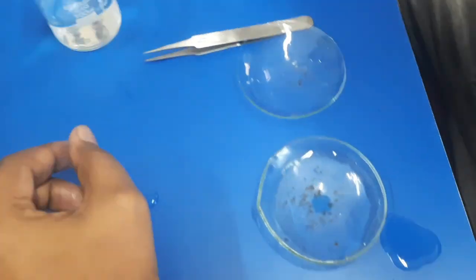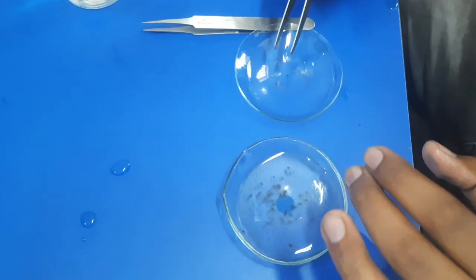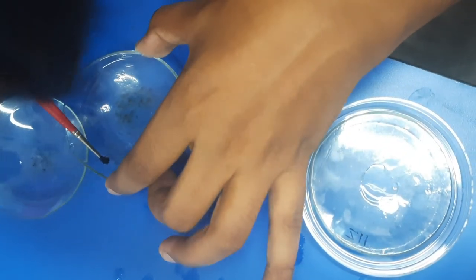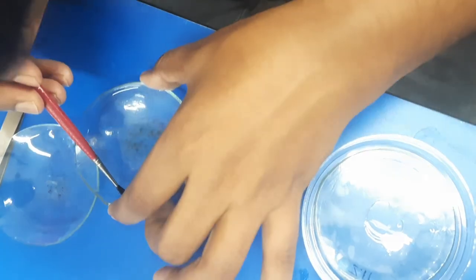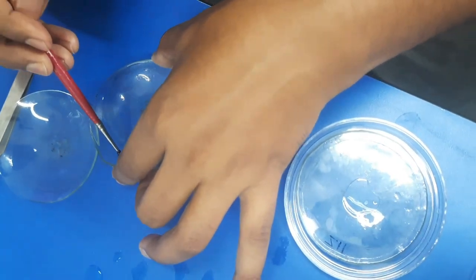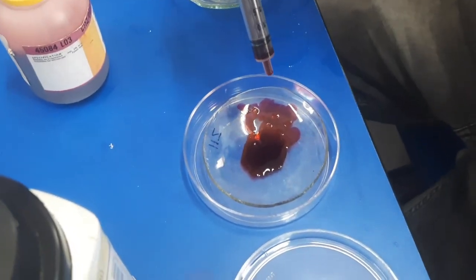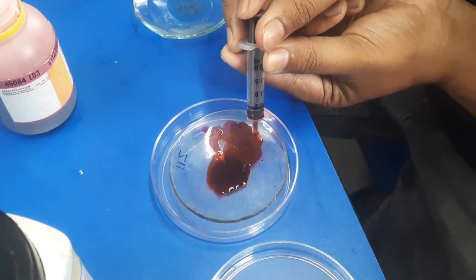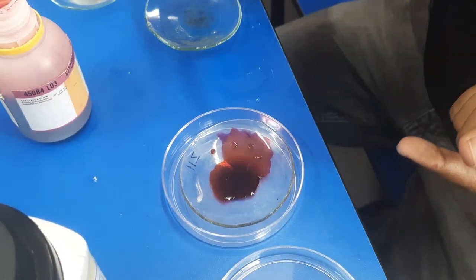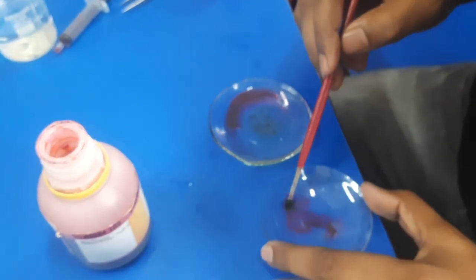We will use a brush or forceps and try to clean the scales a little, so that the blackish pigmentation is removed. After that, from these scales, those which are very well cleaned, we will separate those out.